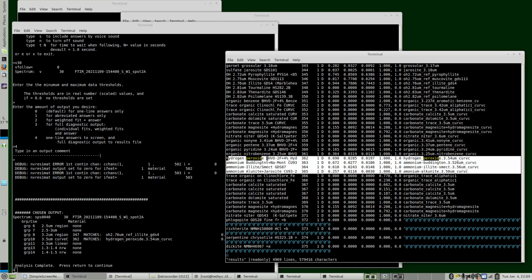And here's the 4 entries, and we see that the hydrogen peroxide is still the best band position. It has a little bit stronger band depth. So for what we're seeing in the soils, the band position is 3.54, whereas these are not capturing that. So we probably need to add some additional ammonium compounds and make measurements of additional ammonium compounds to see if there's a common band position that explains hydrogen peroxide, or maybe there is hydrogen peroxide in the soils. So a learning experience.